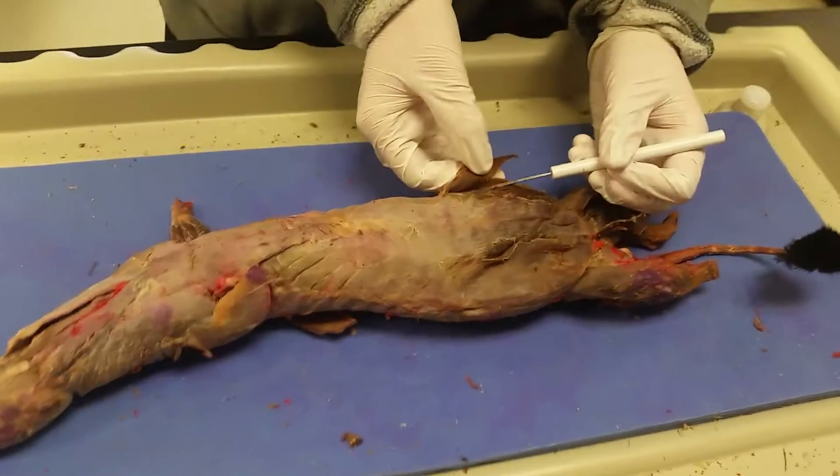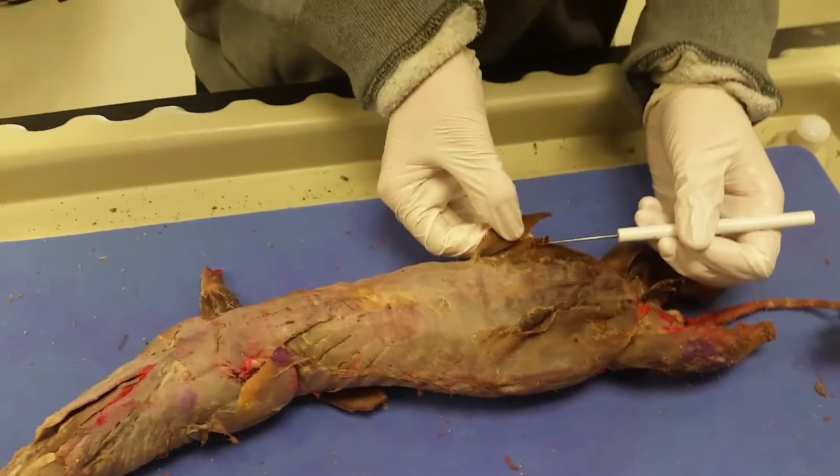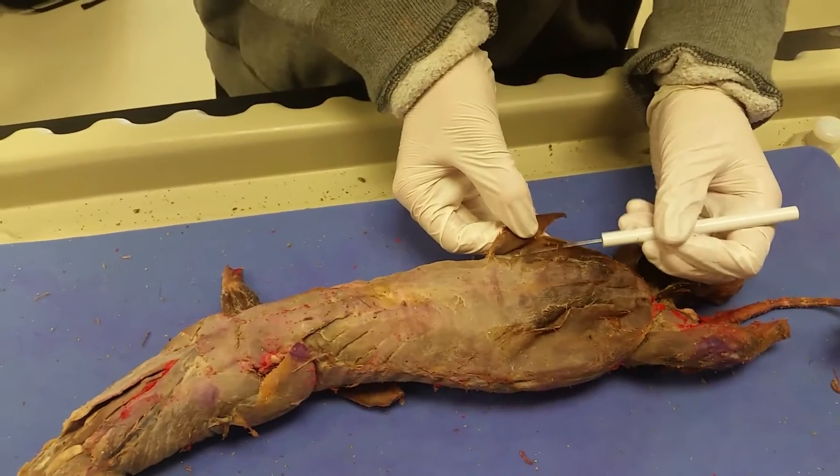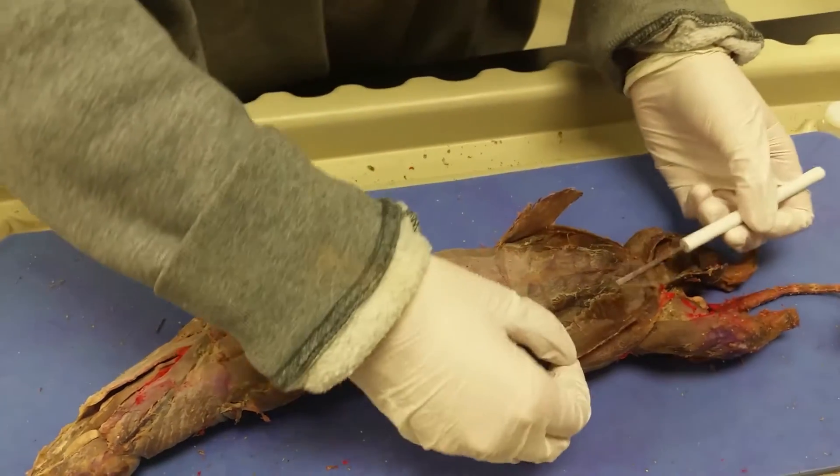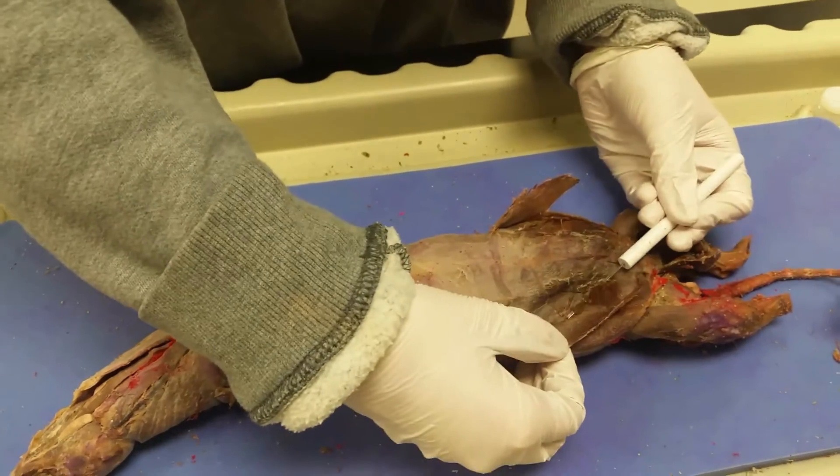Underneath the external oblique is the internal oblique. You can see it better on this side.